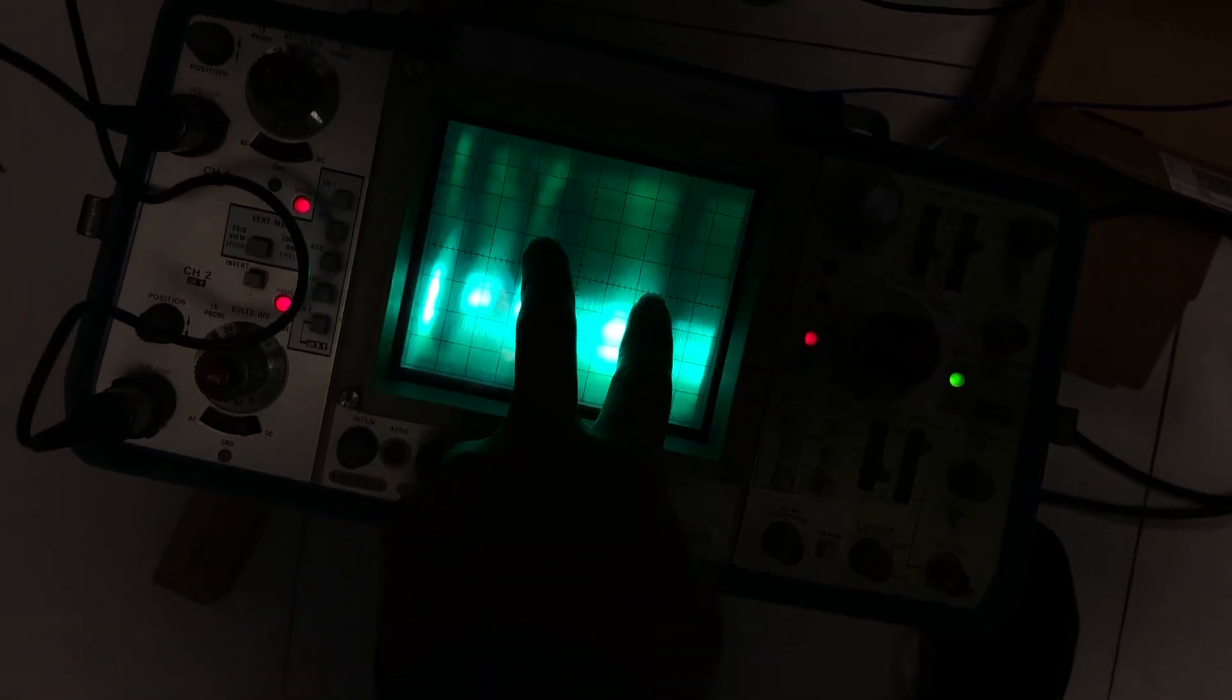Now I'm adjusting the electron beam focus. Now you can see it's focusing, but basically there's nothing on the sample holder. So you can only see a raster that reflects the electron beam, a surface.